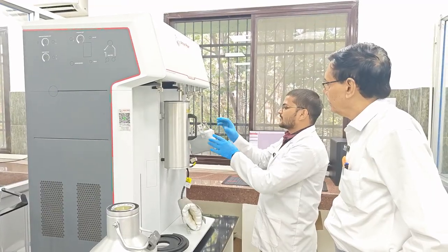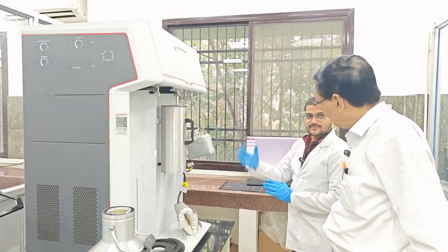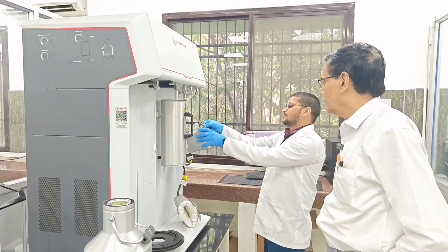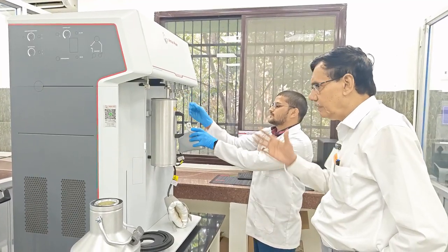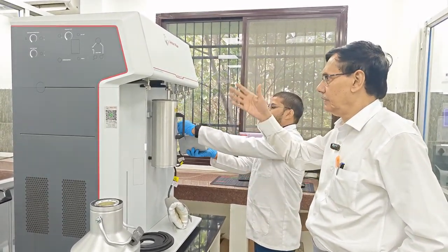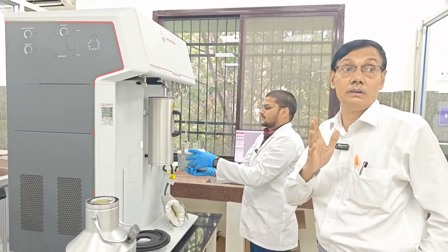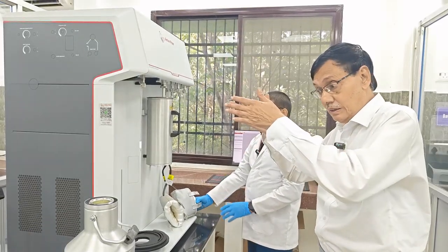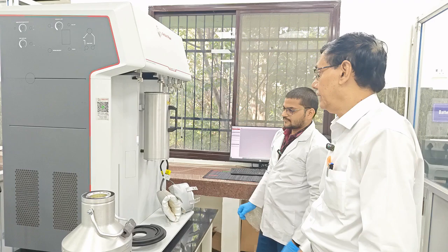After degassing, it may be very hot, but after waiting and cooling, we have to remove it. We should perform this experiment very slowly and gradually. It will take at least 4 to 6 hours to cool down. It will take 4 to 6 hours to lower the 250 degrees centigrade temperature.